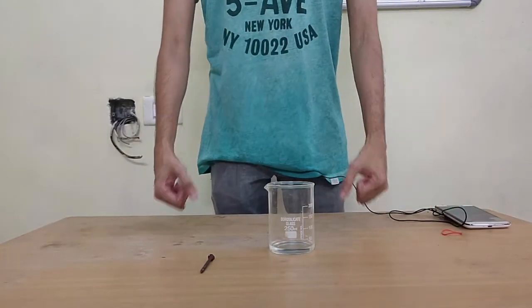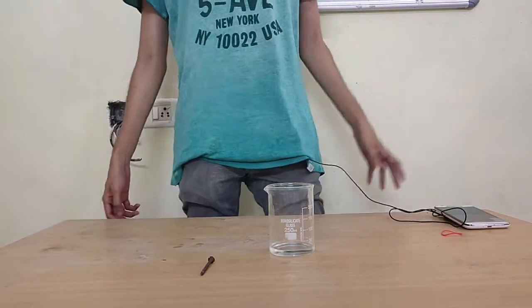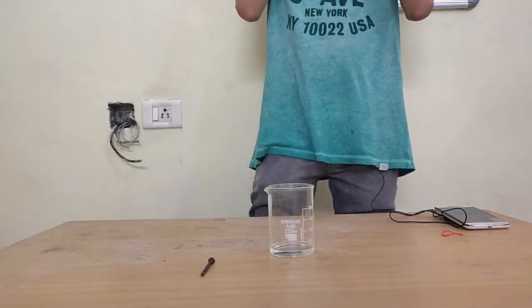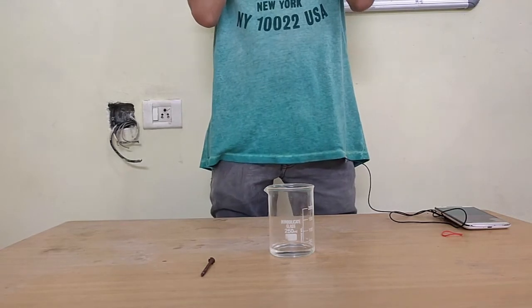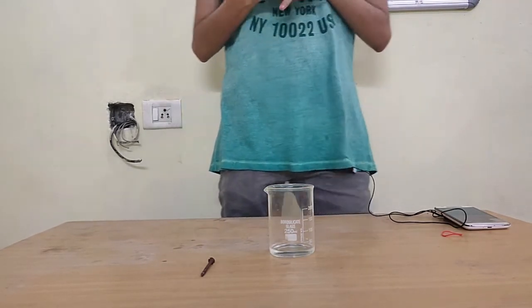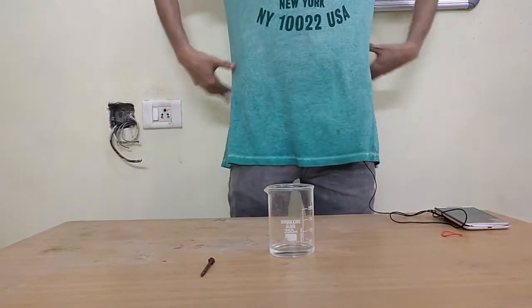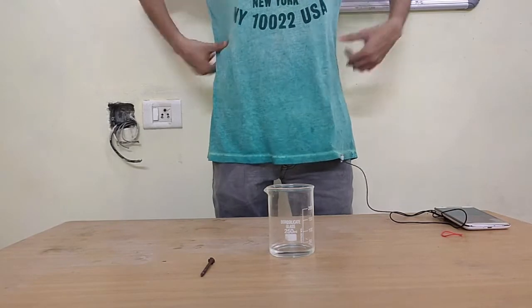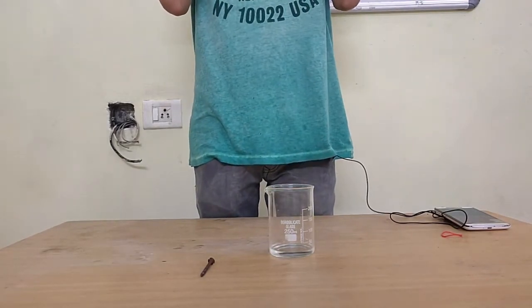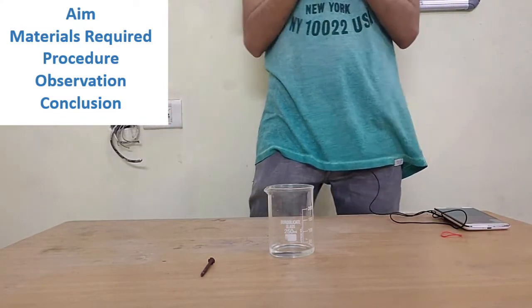Hey guys, so far we have looked at a couple of activities in this chapter regarding acids, mostly ones with a base also. Today we will be looking at one more activity that involves an acid and something else, another type of chemical compound. Since it's an activity again, I'd request you to please use the experiment format to make sure you're noting down everything in the right format.